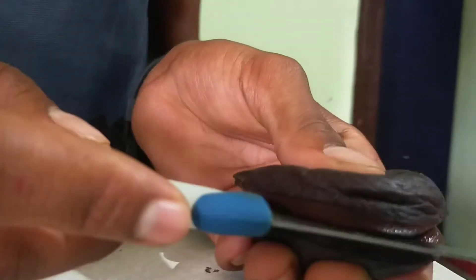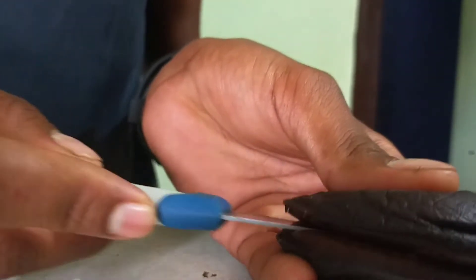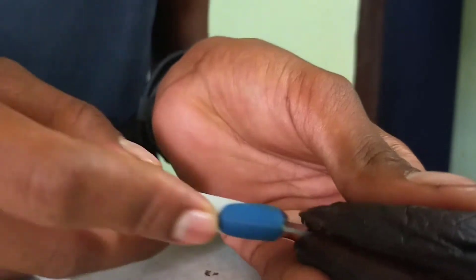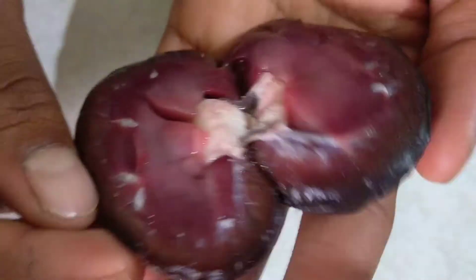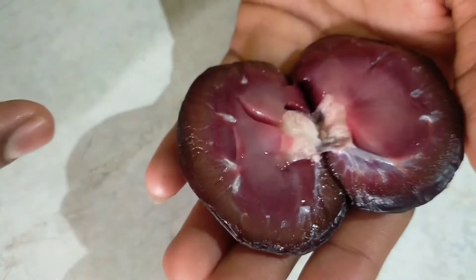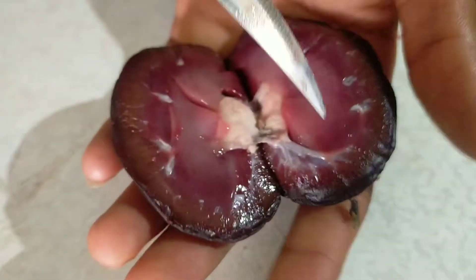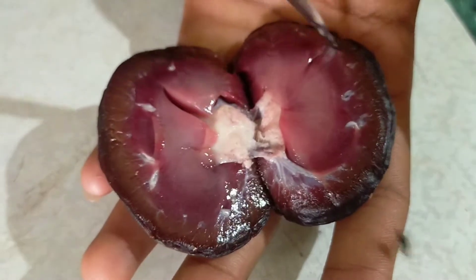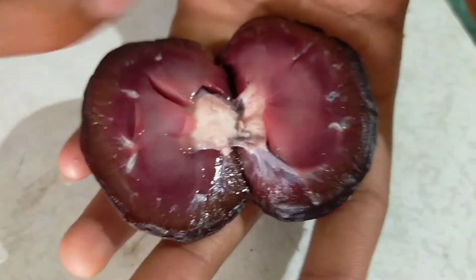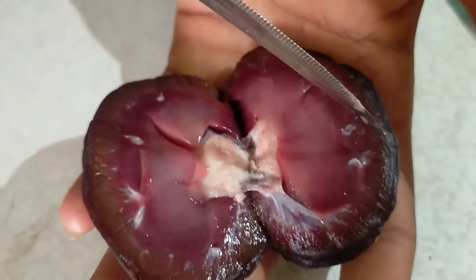I have taken a goat kidney. I am going to cut this goat kidney. First we are going to identify the parts of the kidney. This brown color like structure is known as cortex.